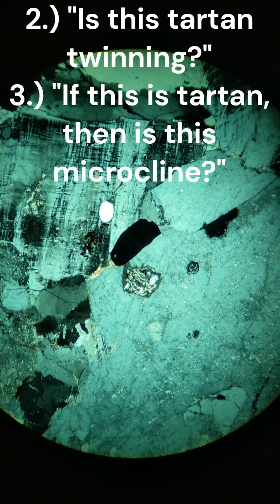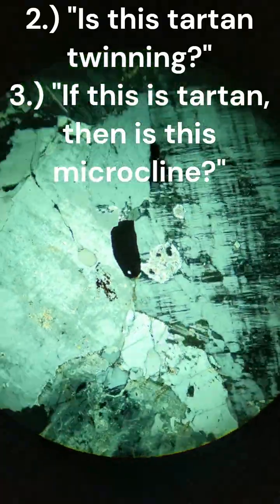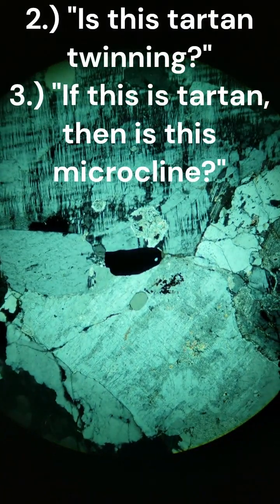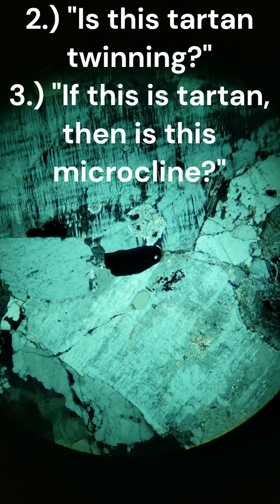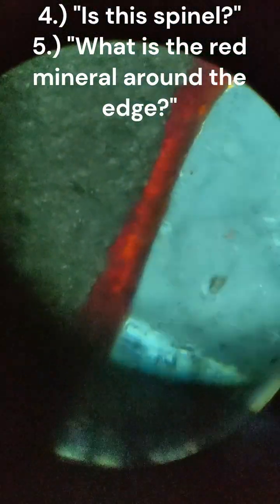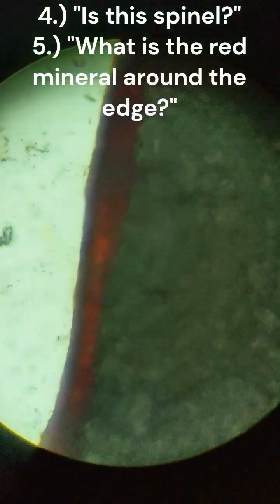This is thin section number 95. Just want to make sure this is spinel. Rotate it all the way around. Tartan twinning on the outside, so I assume the mineral currently on the top there is probably microcline. Mineral in the middle though, going to 63 mag. Moving it around, this is XPL. Going into PPL.